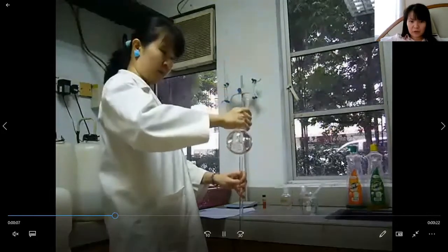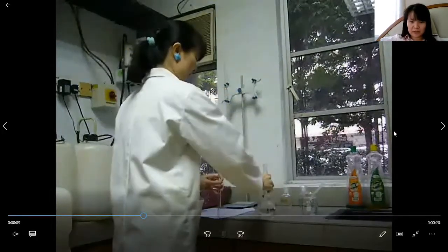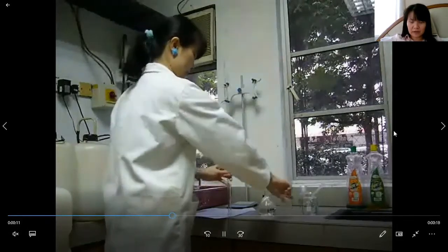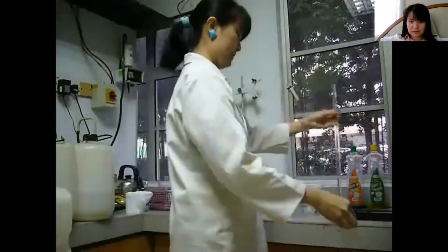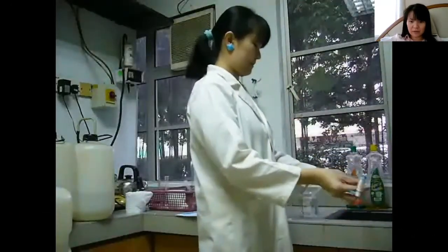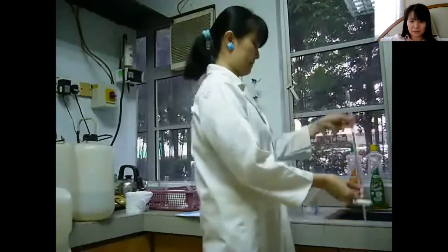Next we're going to wash the burette with the solution it's going to contain. So in this case that would be the acid. We'll use minimal amount of acid to wash or rinse the burette.